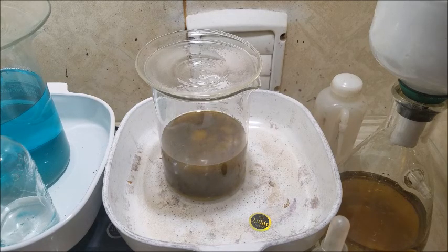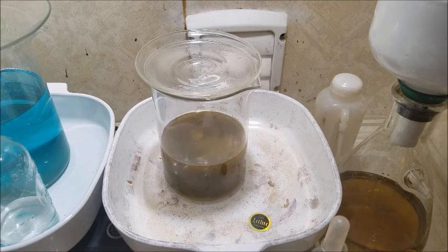I have a new filter set up in another Buchner funnel here. Once this comes to room temperature, I'm going to filter it out. I was just going to sit here and watch it, but as I'm watching it, you can see things starting to bubble up as it's cooling down. At the very bottom of the beaker, you can see some sediment forming, which I believe is either the pulp from the filters, or some sort of silver chloride, I'd imagine.